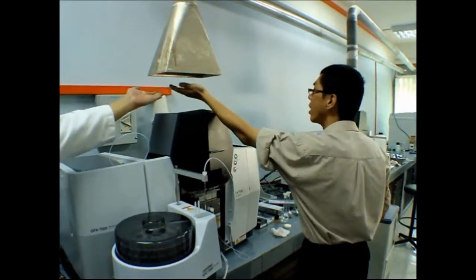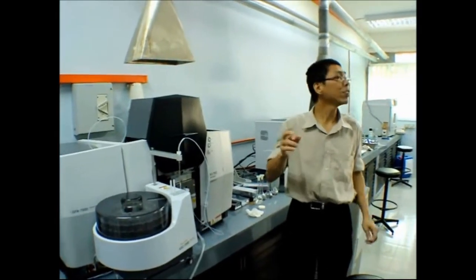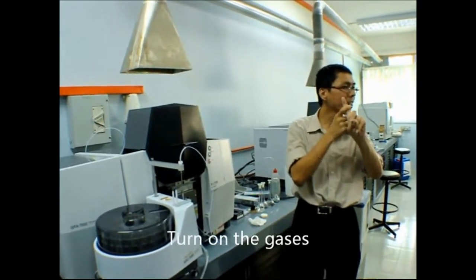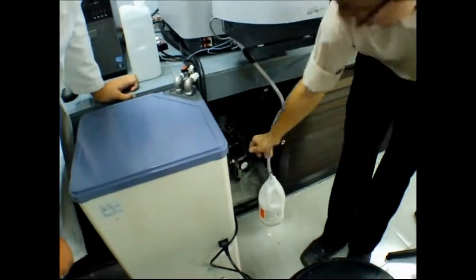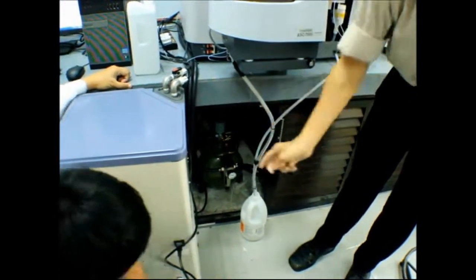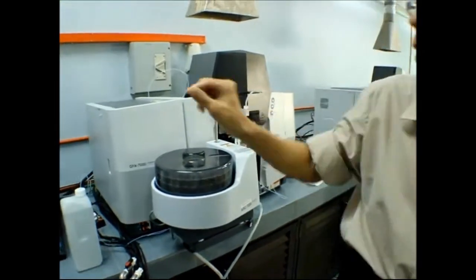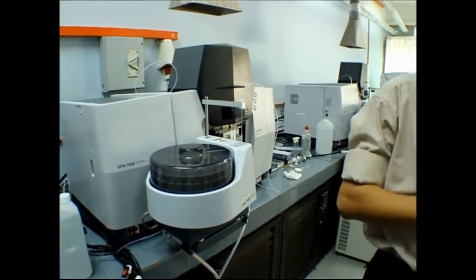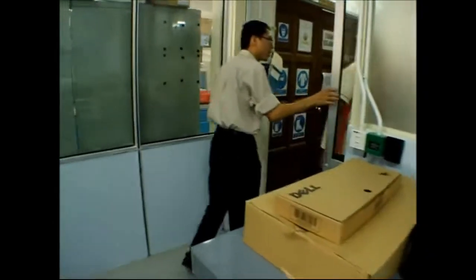Then you need to switch on your gas. Still remember what gas you are using? Acetylene and air. Air is this one, just switch on. Switch on your generator. Then acetylene. Any regulator here? No. Look, oh, this side only.